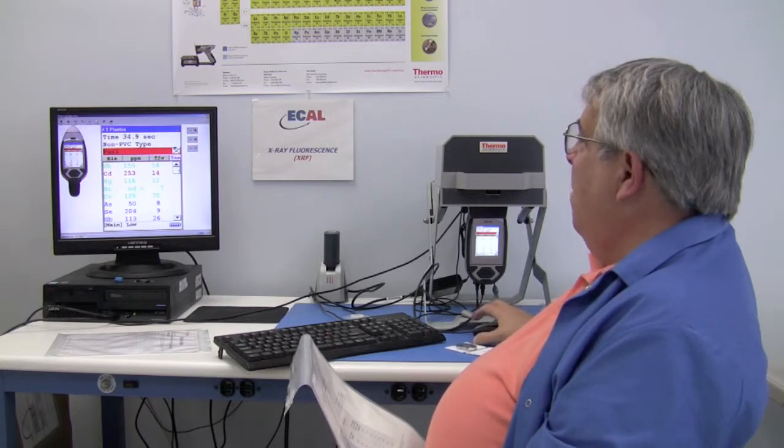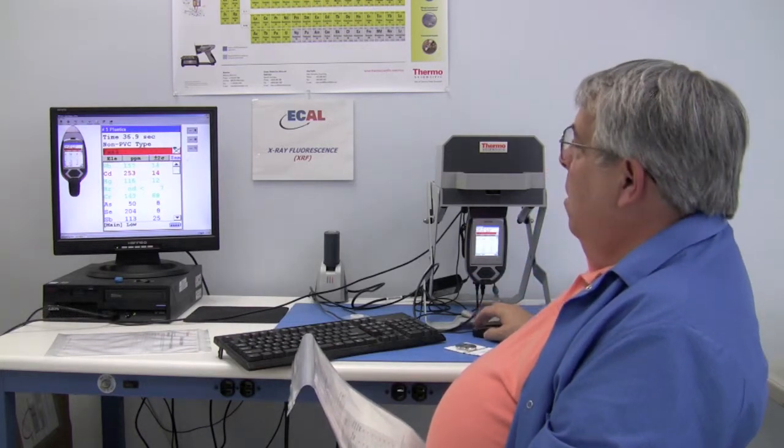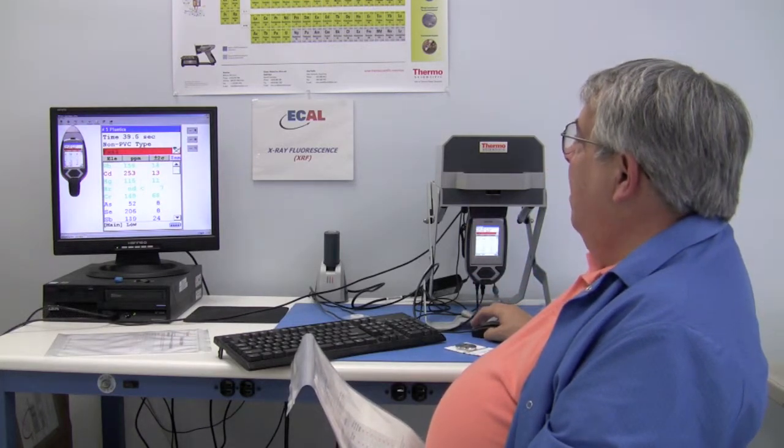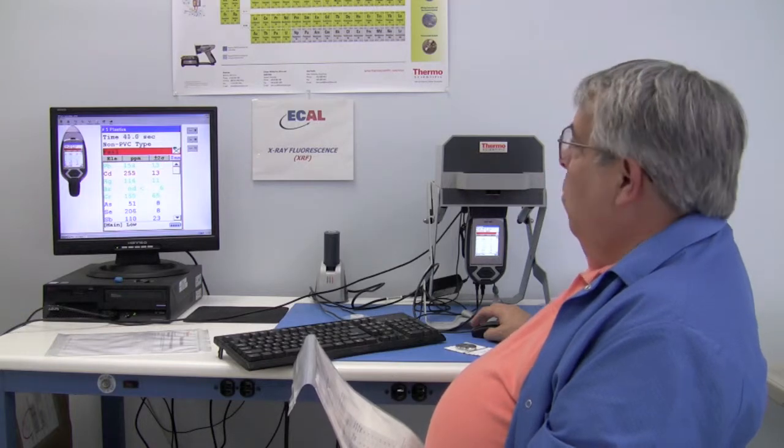All right, so we've gone past the minimum time. But by the way, if you notice that it failed right away, one of the interesting things about this is if it fails, it can fail in two seconds. But if it's going to pass, it has to have at least gone to 30 seconds.